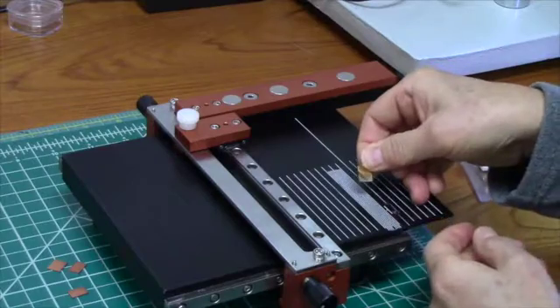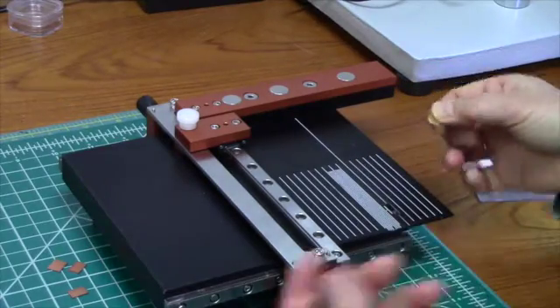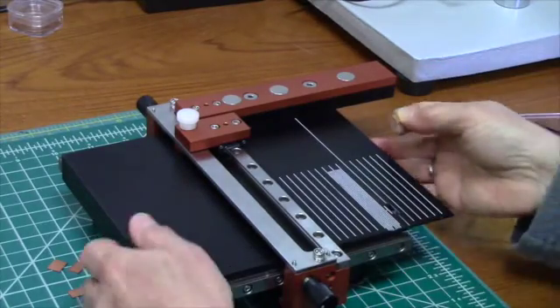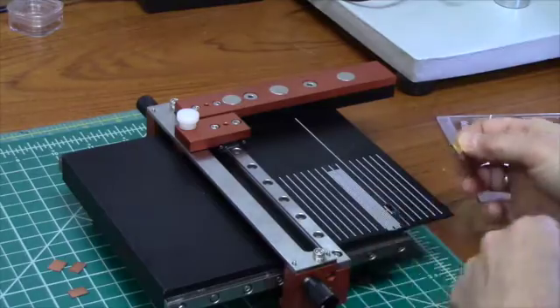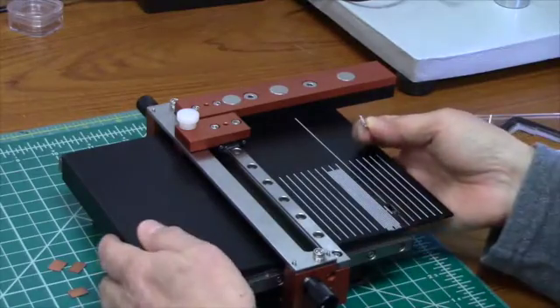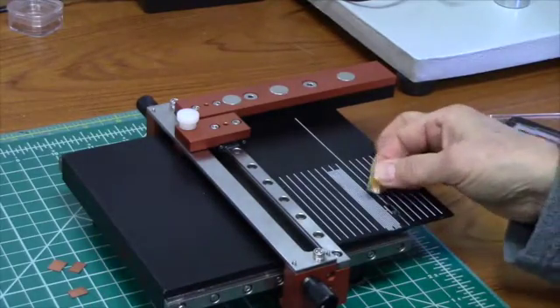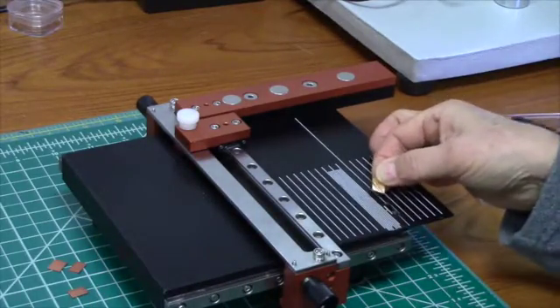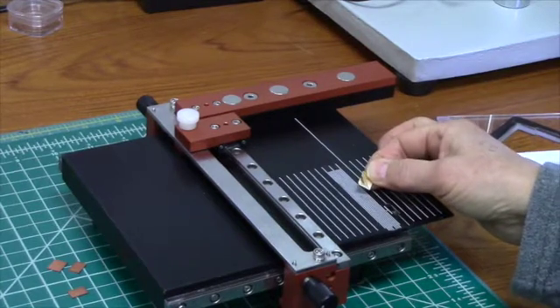There, I've got my scribe. Now I can either cleave over the diamond scribe, or I can use some other method to cleave my sample.